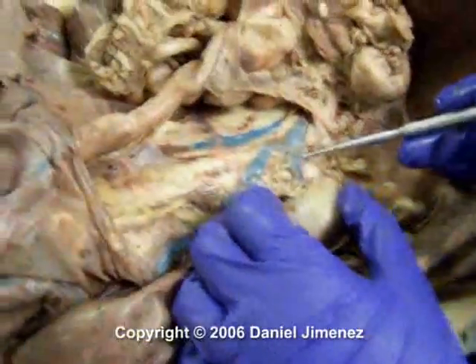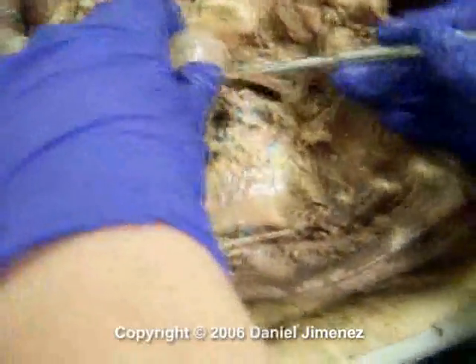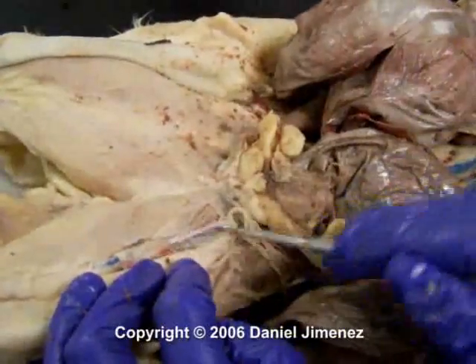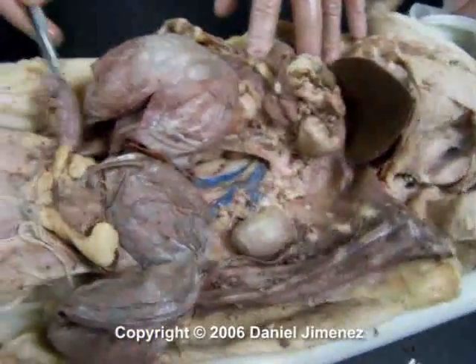On your kidney, underneath your renal vein, you have your renal artery. And you just need to know one kidney. And then the other location you need to know is your femoral arteries in your leg. So this would be your left one, and then you have a right one as well. And that's a kitten. That's it.